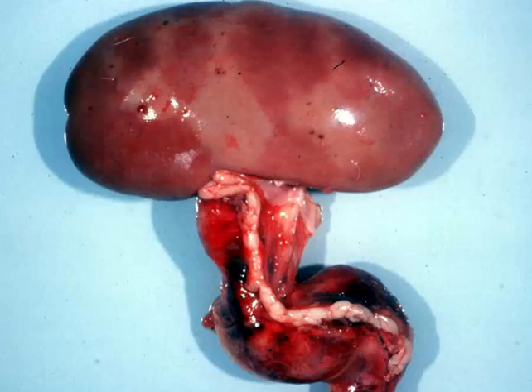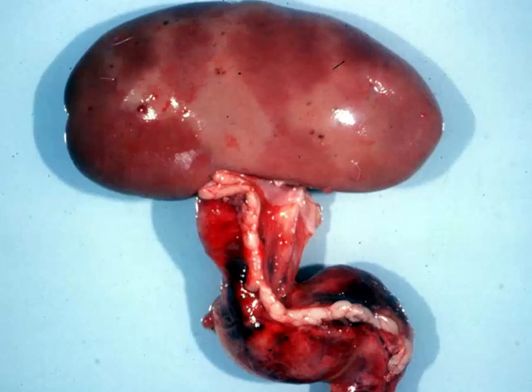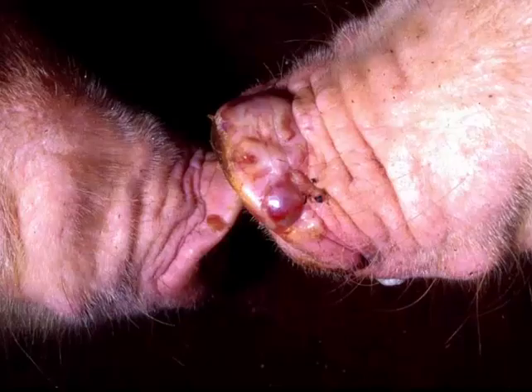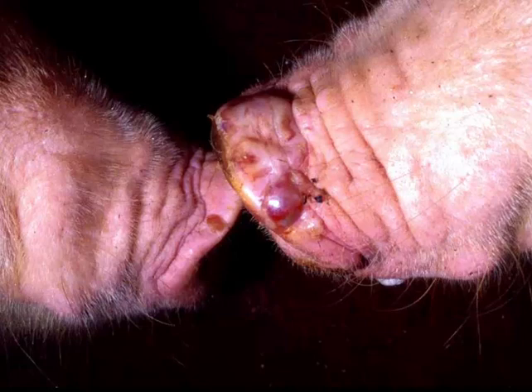Looks like we've got a lot of pigs in this quiz. Are you ready for one more pig? I'm going to ask you for a long differential diagnosis — one of the longest ones that you'll have to know. Tissue from a pig. How about a morphologic diagnosis and give me five causes? I'm going to give you a full two minutes to rack your brain.